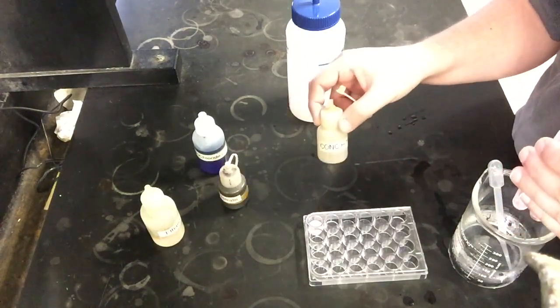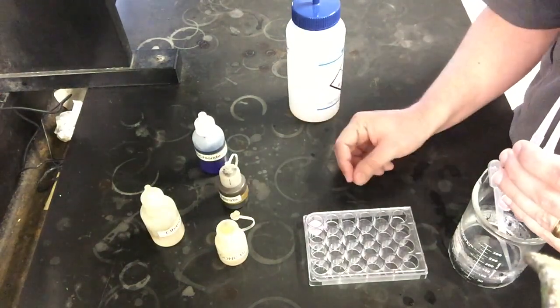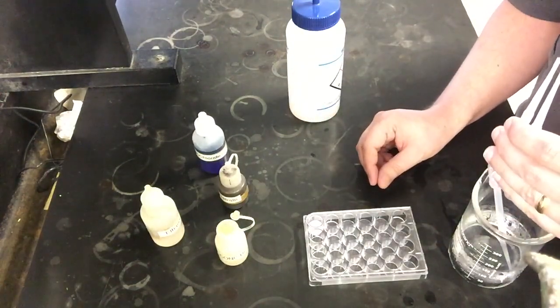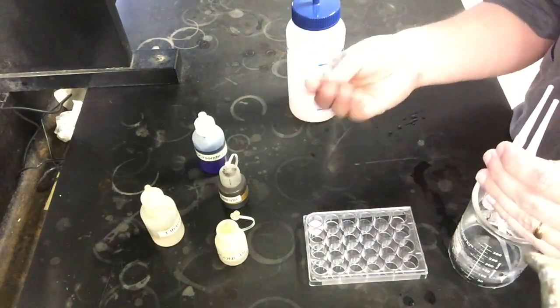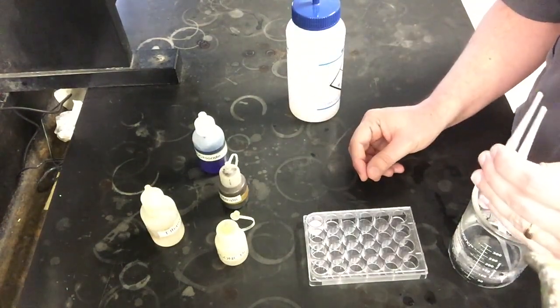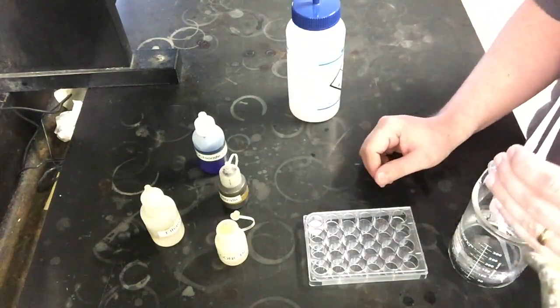Things like concentrated hydrochloric acid, you probably don't want to get that on your bare skin. You might have seen me even flinch a little bit earlier because I did get one drop of it on a finger. That's something you obviously would like to avoid, but it's such a small amount. As long as you rinse your hands really well, which is what I did after our video clip, then it should be fine. Nothing's too terrible here in that regard.